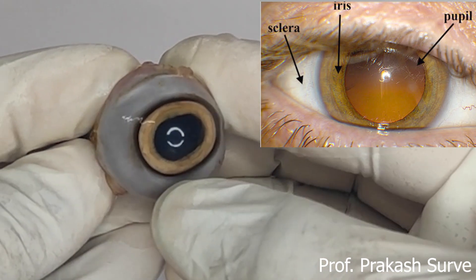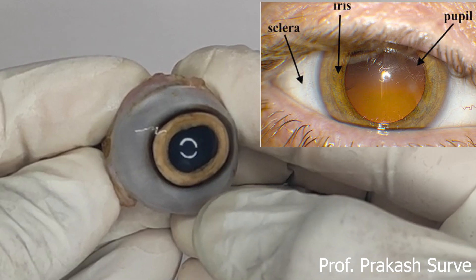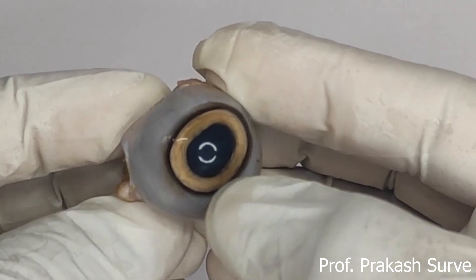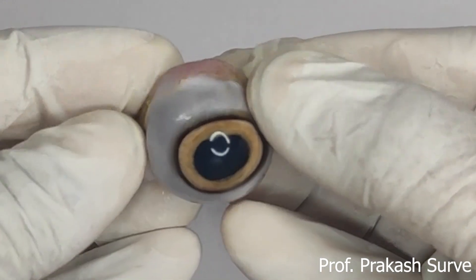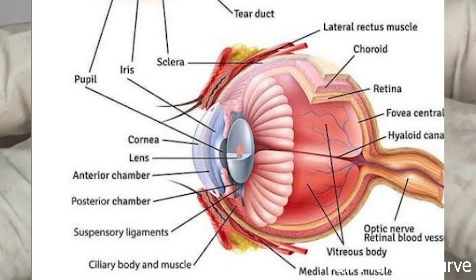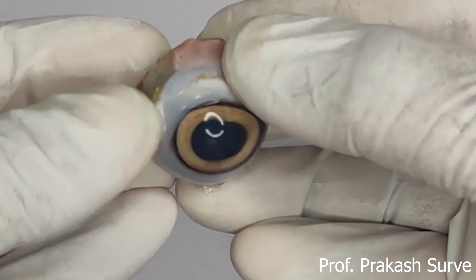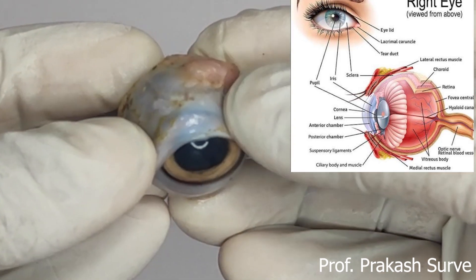The light brownish portion visible is the iris, and at the center we find the pupil. The iris controls the size of the pupil depending on the intensity of light — the pupil either increases or decreases in size. There are six sets of muscles for movement of the eyeball. The thin skin forming the eyelid is also visible.